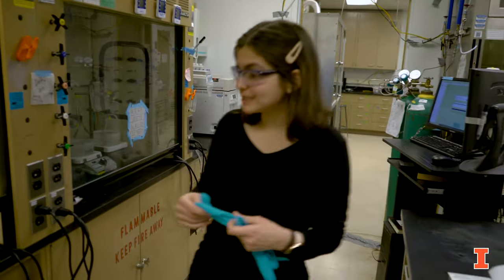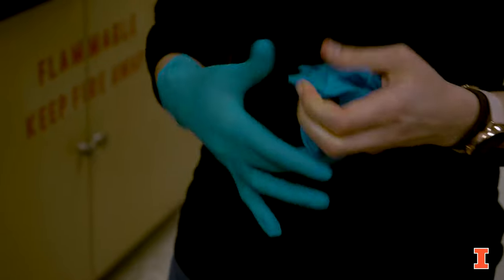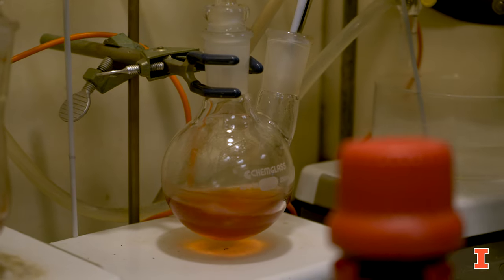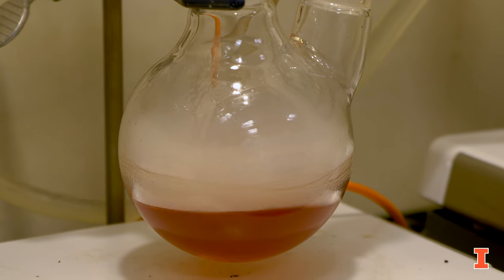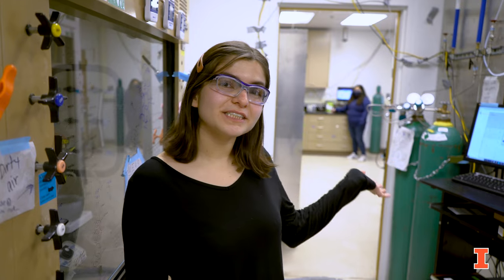Here, I'm currently synthesizing two catalysts for epoxidation. Both are titanium supported on silica. Next, my lab mate Grisha will share her work with you.